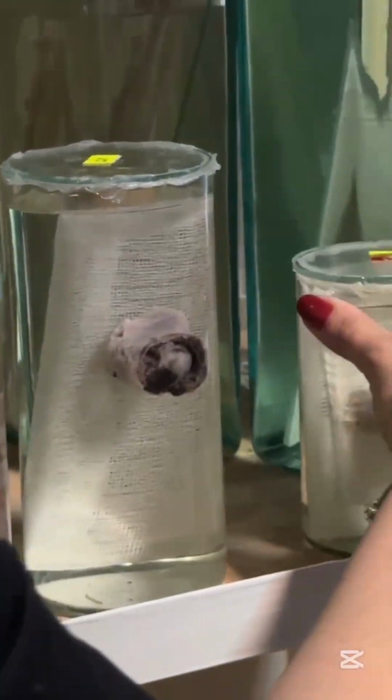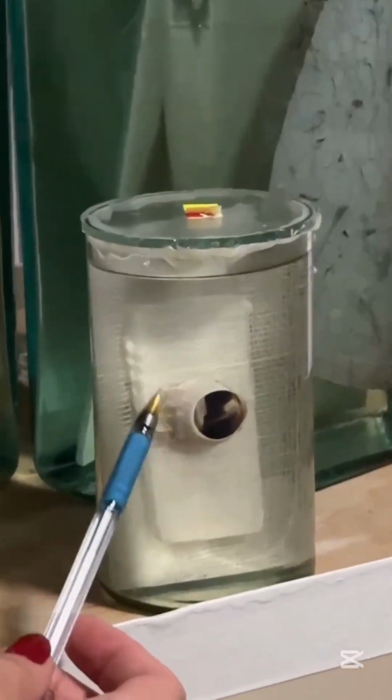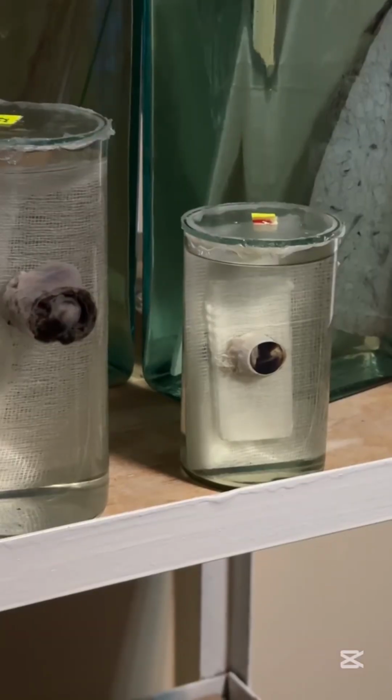This one may be absent, I don't remember again. That is melanoma of the eye, easy. You see the black area, melanoma, malignant tumor of melanocytes.